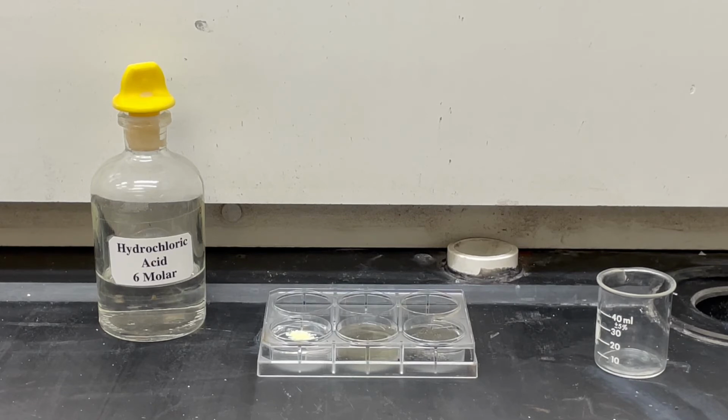The bubbles that form from the reaction between hydrochloric acid and iron(II) sulfide are hydrogen sulfide, H2S. Hydrogen sulfide has the smell of rotten eggs and is highly toxic, which is why I'm running this in a fume hood. Speeding this video up a bit, you can see the differences in bubble formation between the iron and iron(II) sulfide.